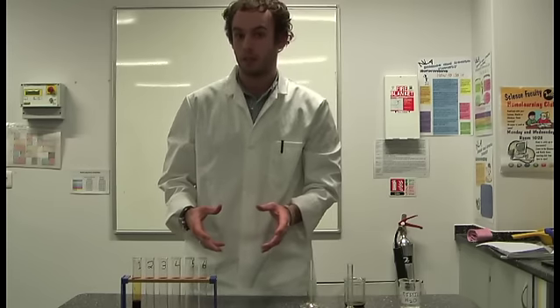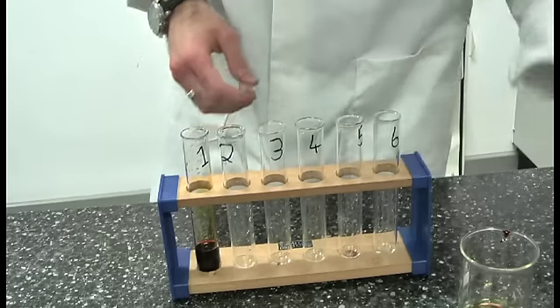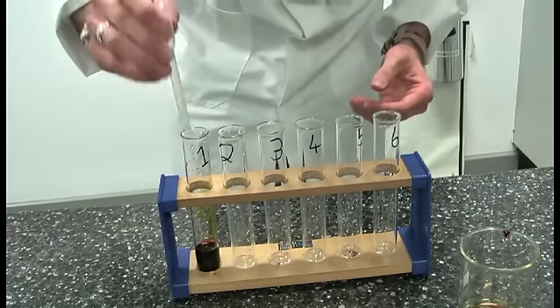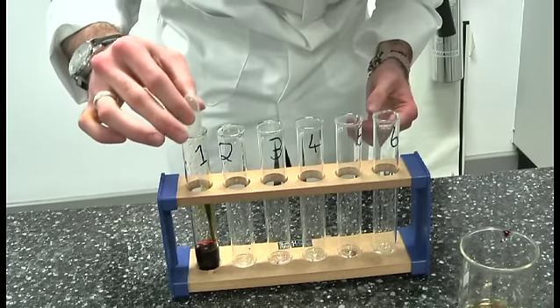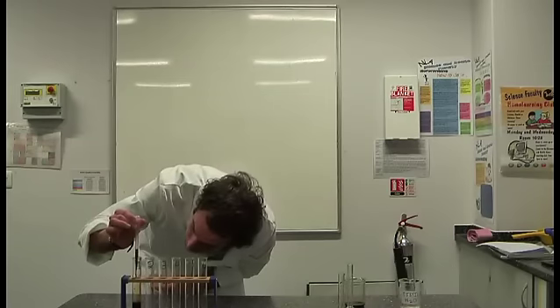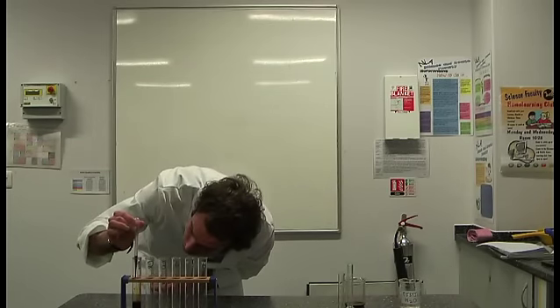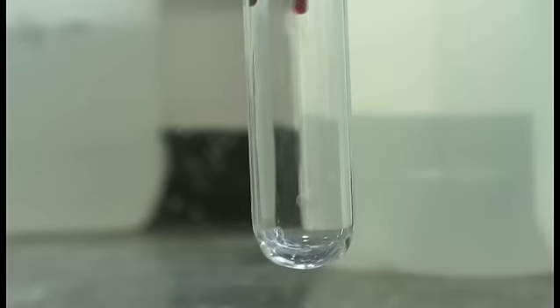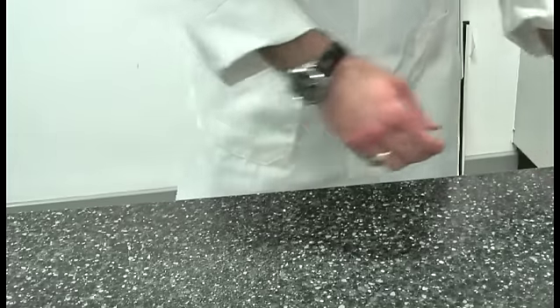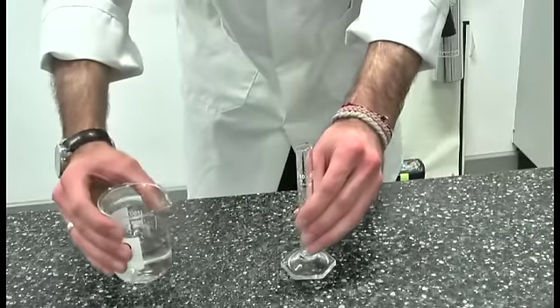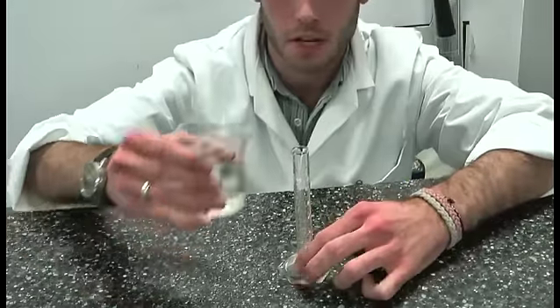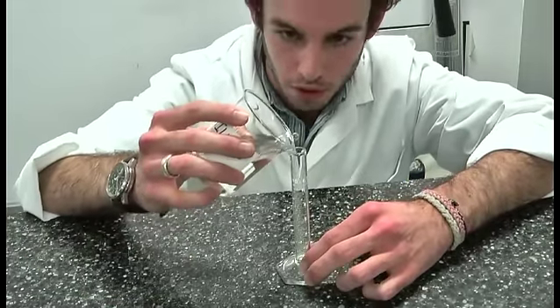Let's do this. Using a clean graduated pipette, you're going to remove one milliliter of our stock solution, again at eye level, transfer that into test tube two. And using a clean measuring cylinder, again accurately reading from the bottom of the meniscus, we're going to measure out nine milliliters of distilled water.